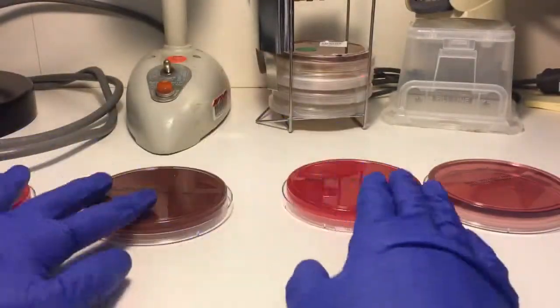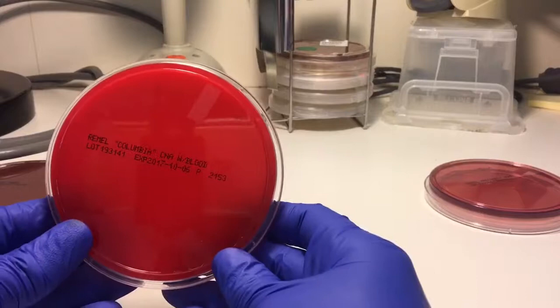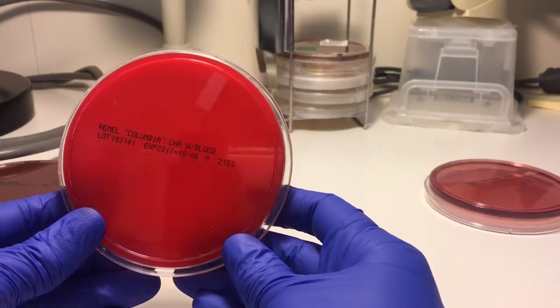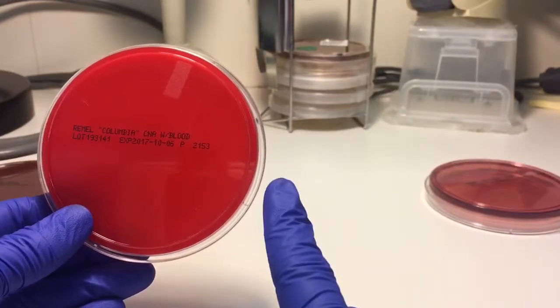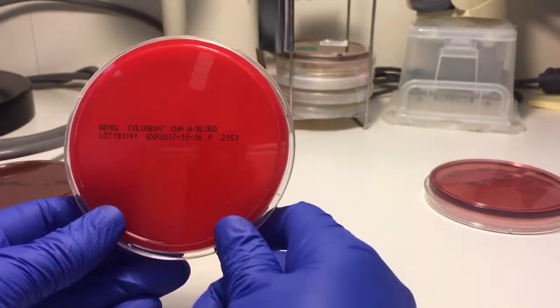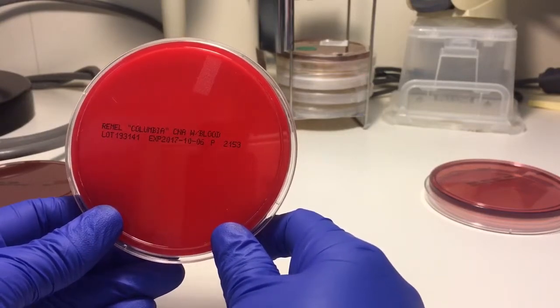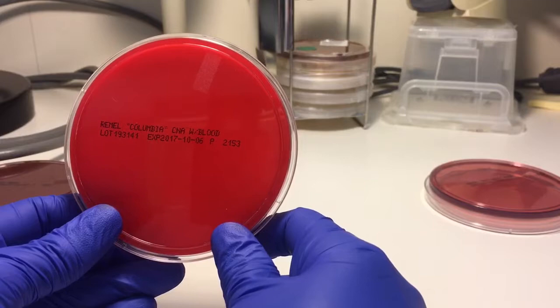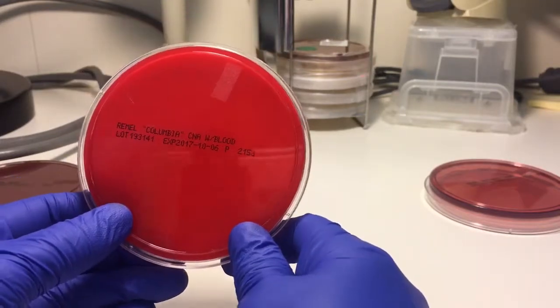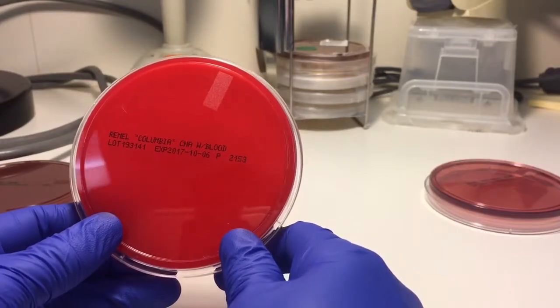The next one is the CNA plate. CNA stands for colistin and nalidixic acid. It is considered a selective plate — it fosters the growth of gram positive bacteria and inhibits gram negatives, although some strains of Proteus mirabilis can grow on CNA, so that's something to keep in mind.